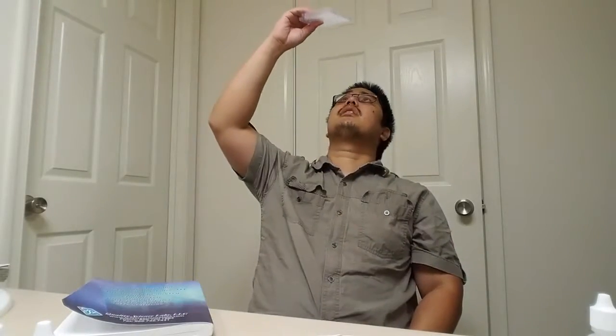Another thing you can do is, okay, wait 1 second. Okay, another thing you can do is hold this up to the light, and maybe you might be able to see it a little bit better that way. And so basically now you can observe the reactions that took place in this case. Cool. Now the most important thing is the cleanup.